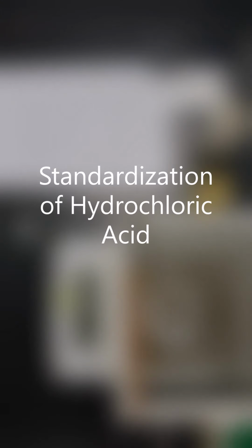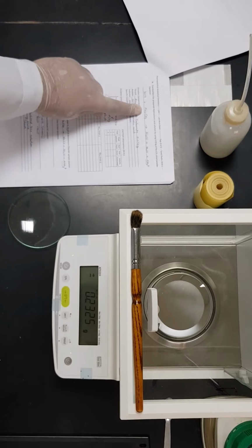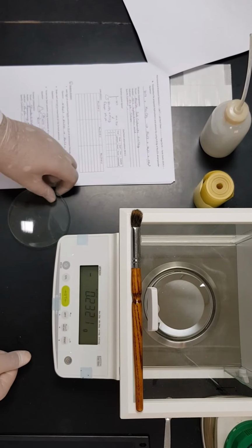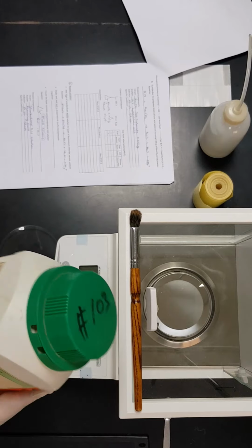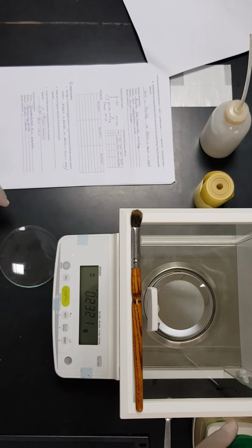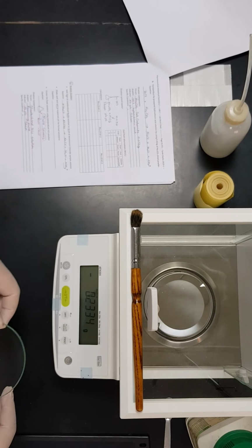Okay, now we are going to proceed with the standardization of HCl solution. And as you know, to standardize HCl solution, we need sodium carbonate. As we know, sodium carbonate may have hygroscopic property, but we are already using sodium carbonate which is anhydrous. But we have to make sure that all the moisture content in the sodium carbonate was removed.